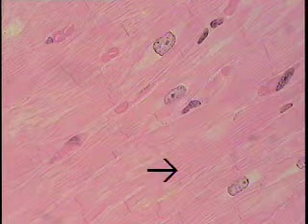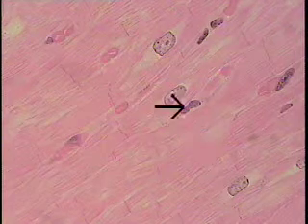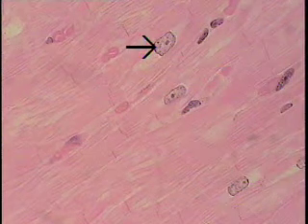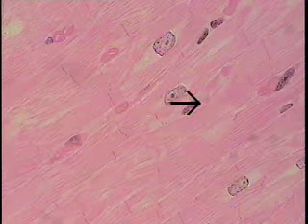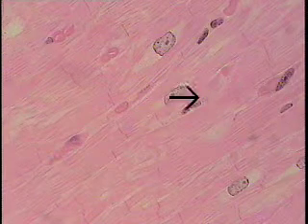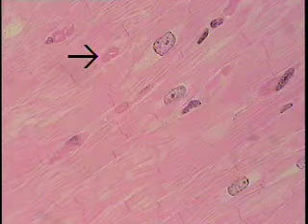And one can see in the background the striations of these myofibrils, which aren't nearly as closely packed as skeletal muscle, and this is why the nuclear profiles remain within the center of the cardiac myocytes. Dark nuclei, such as indicated by the pointer scattered within the field, are endothelial cell nuclei, and occasionally one can see remnants of red cells in this cardiac muscle tissue as well, as one would expect, because this is a very, very vascular tissue.